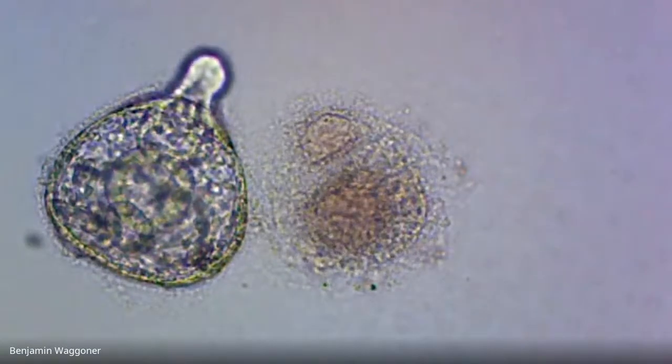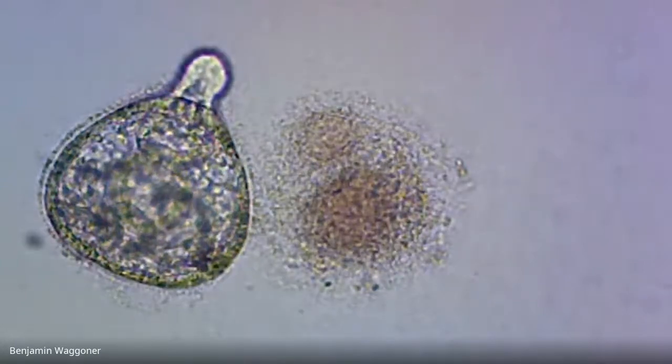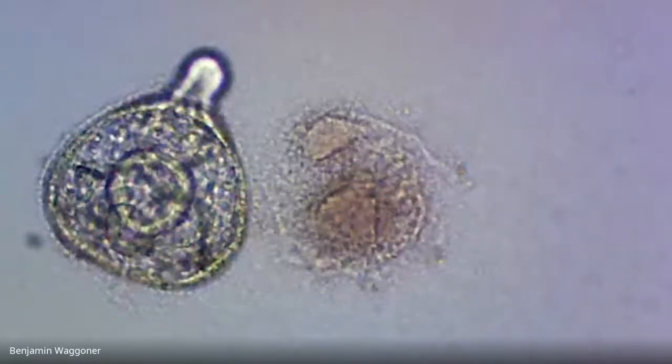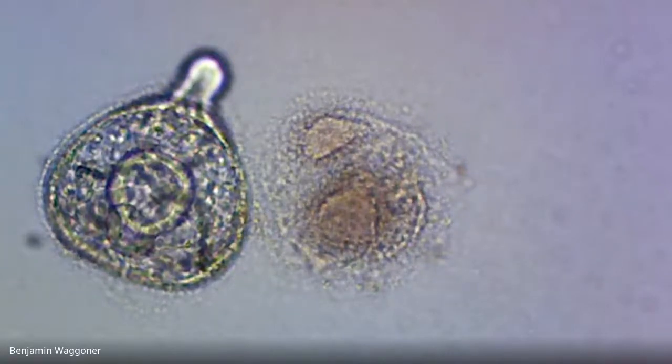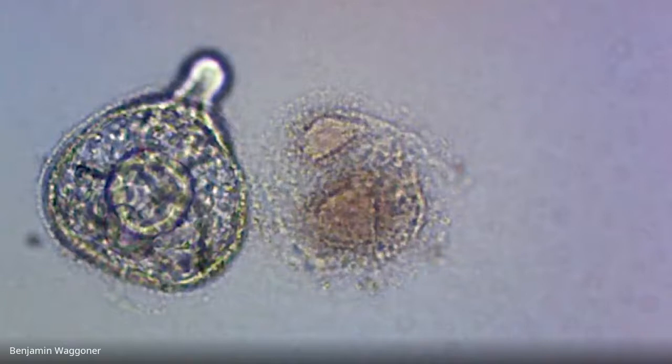Okay, tell you what, I'm going to make one more slide from the nickel, see if we can garner any more data. I'll leave that up for the moment, but I'm going to do one more slide.